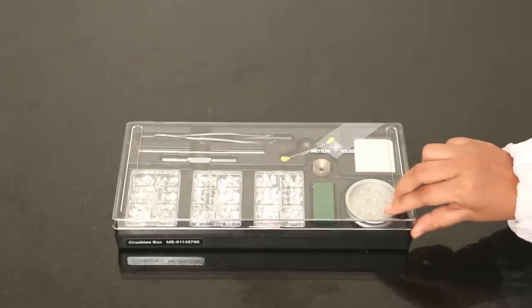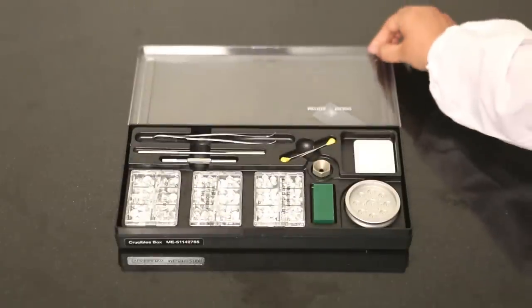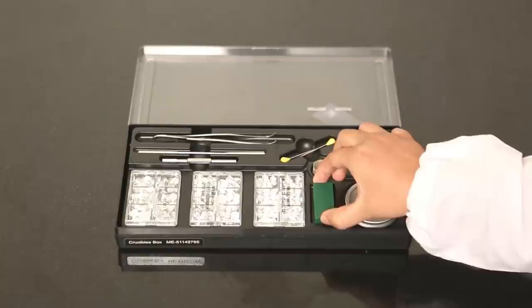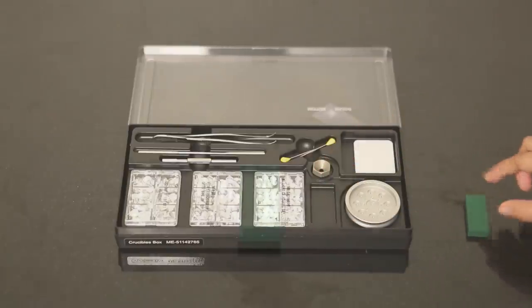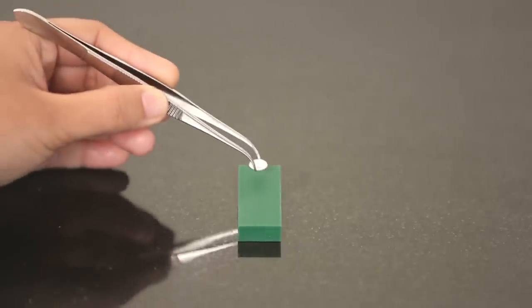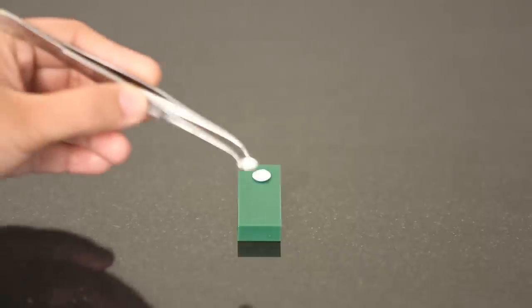Let's start with the preparation of a powder sample. In order to allow the atmosphere above the sample to expand, the lids are pierced. The different number of holes make the sample and reference easier to distinguish.